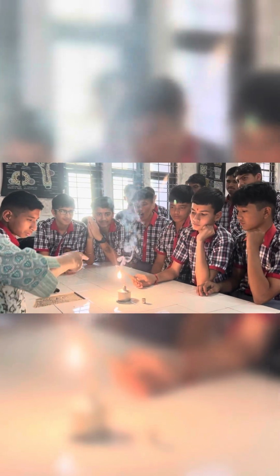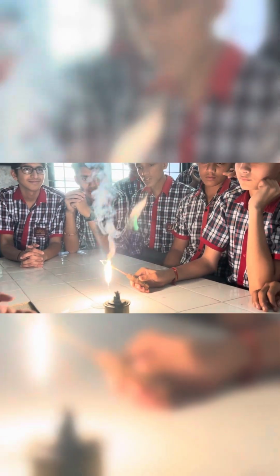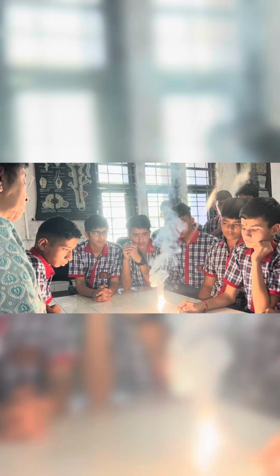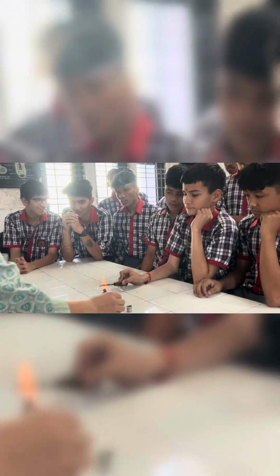So, what do you observe, Aryan? I observed that when the magnesium ribbon is being burned, a dazzling flame is produced. Something new is forming. This is the magnesium oxide. Okay. Magnesium oxide.